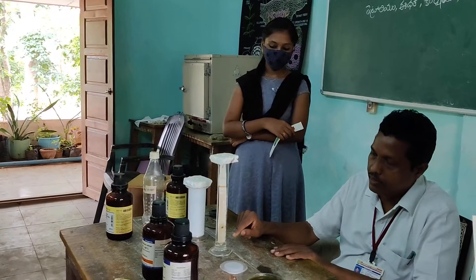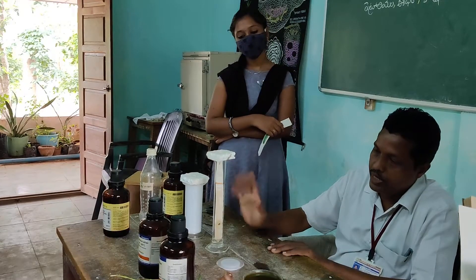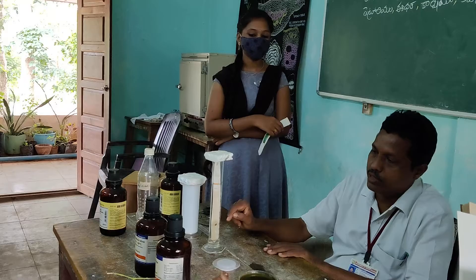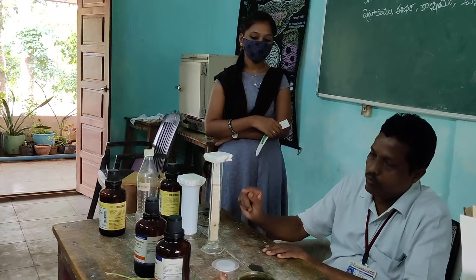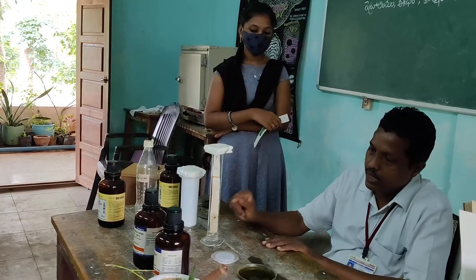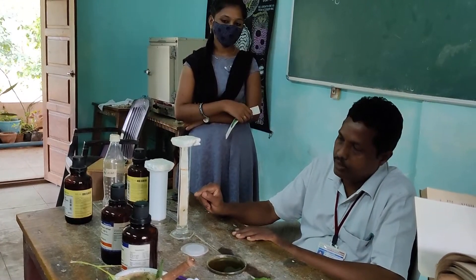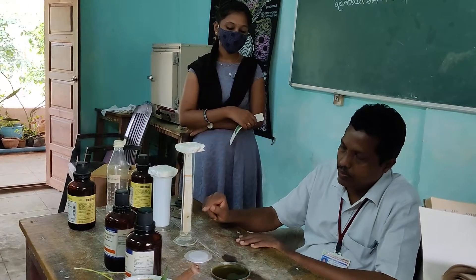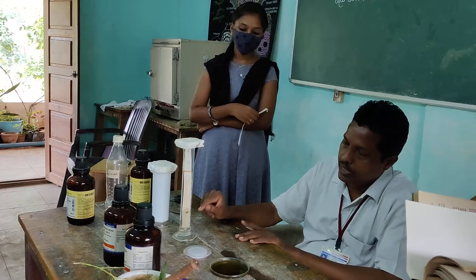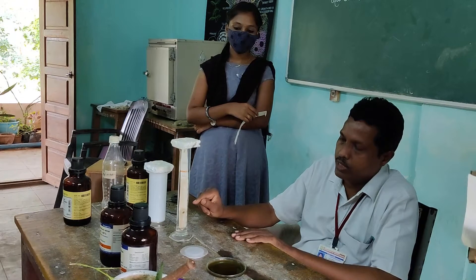This is the solution that we have from the leaf paste. There is chlorophyll B, carotene, and xanthophyll. There is a lot of chlorophyll. If you have chlorophyll, you can see the pigments separated.